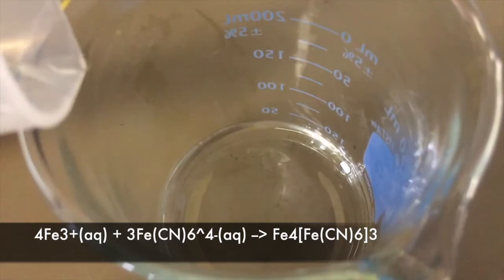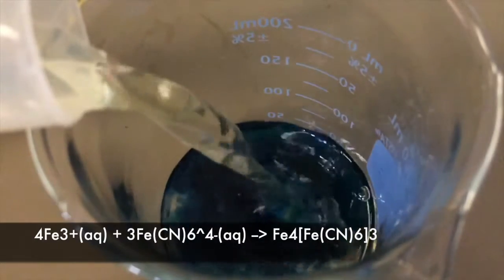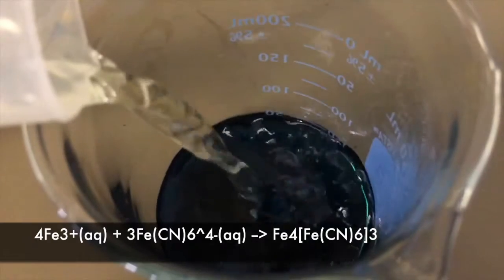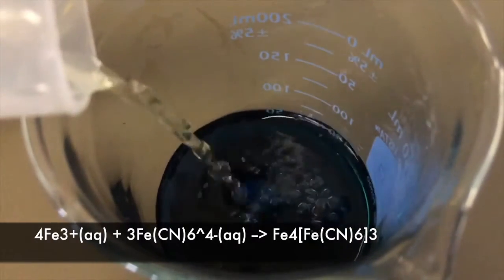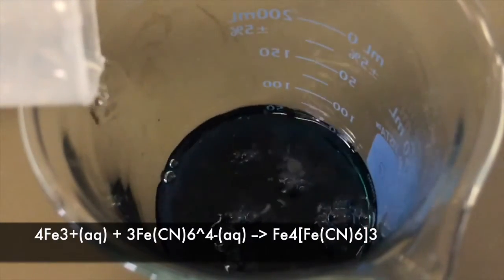This also goes back to Le Châtelier's principle, because by adding 40 milliliters of the iron 3 chloride and only 20 milliliters of the potassium ferrocyanide, the reactants have too much iron. To get back to equilibrium, the reaction moves to the right again, which is our product. This product is the ferric ferrocyanide, which gives us the dark blue color that we see here.